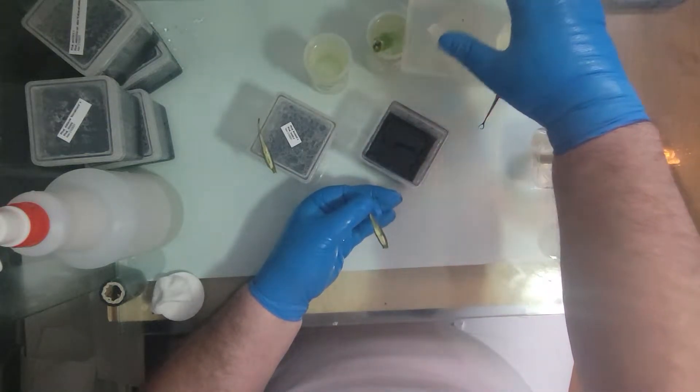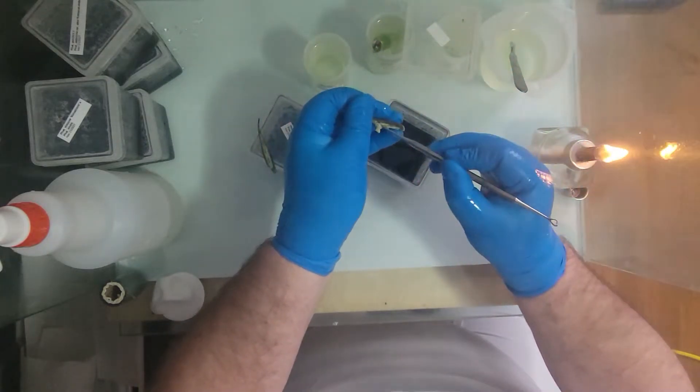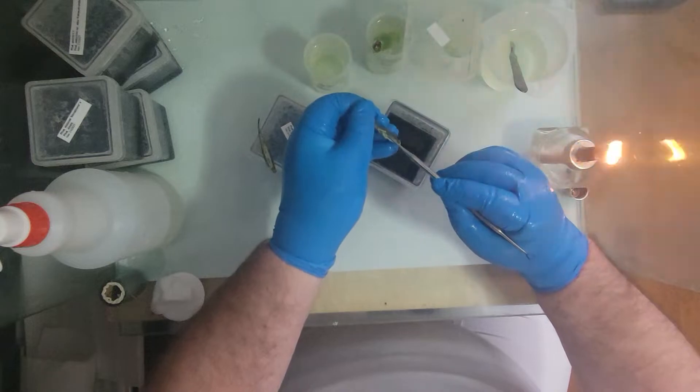Open the lid. This white mass is actually seeds. So we are going to gently pry it out and put it into the flask.